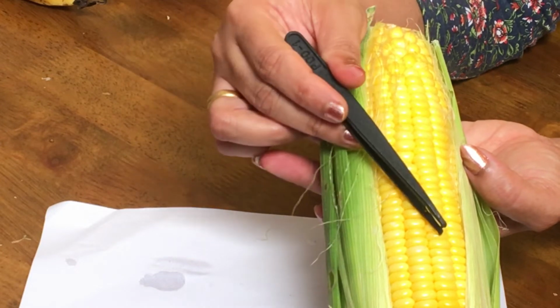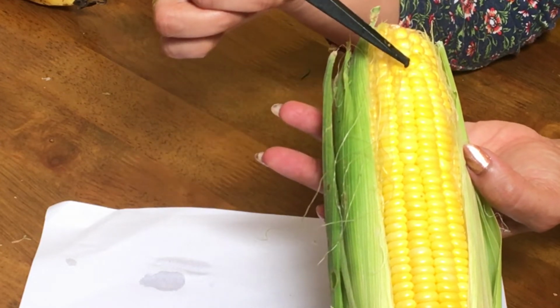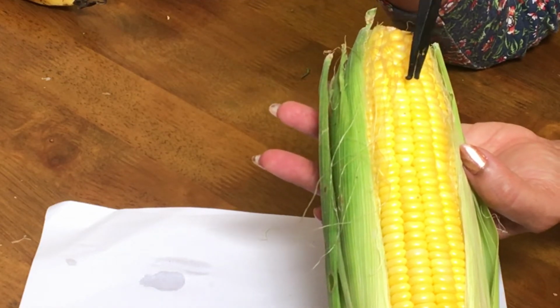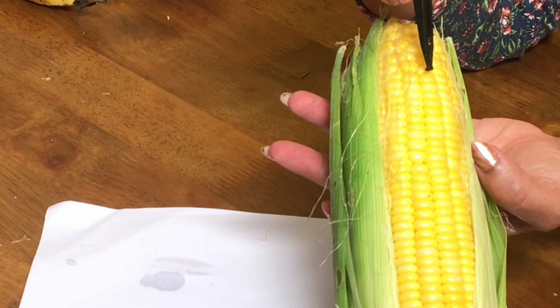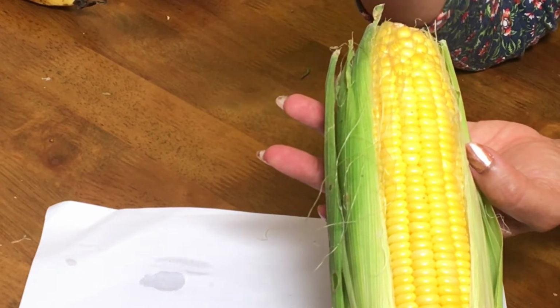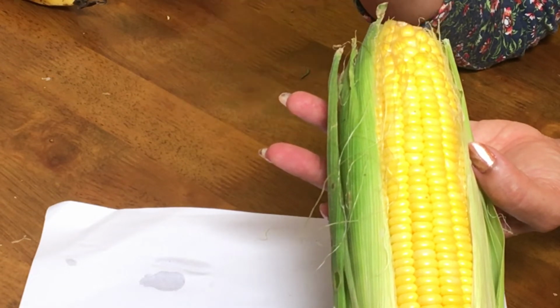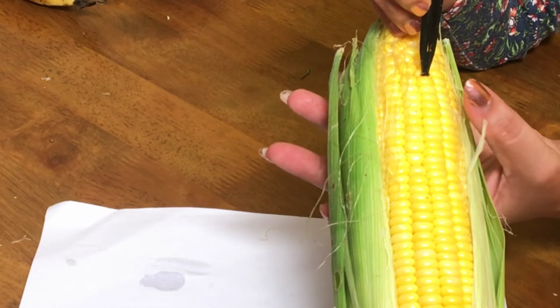There were flowers before, they underwent fertilization and the pistil became the fruit, and inside the fruit there is a seed. But here in the case of this kernel or the fruit of corn, the fruit wall and the seed wall are actually very closely fused together. So we can say it is a grain. So grains are something where the fruit wall and the seed wall will be very close together, fused together, and has a seed inside or embryo inside.